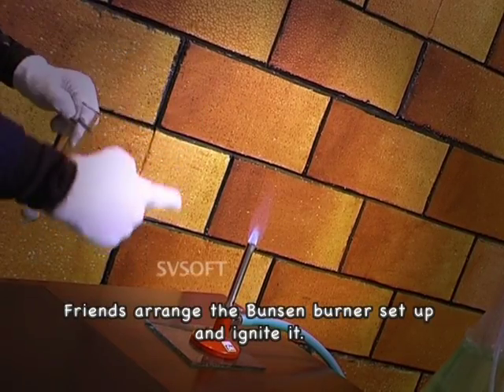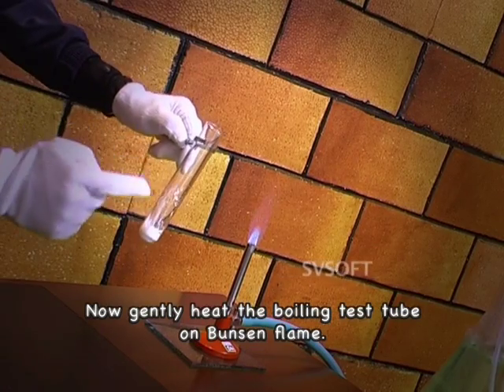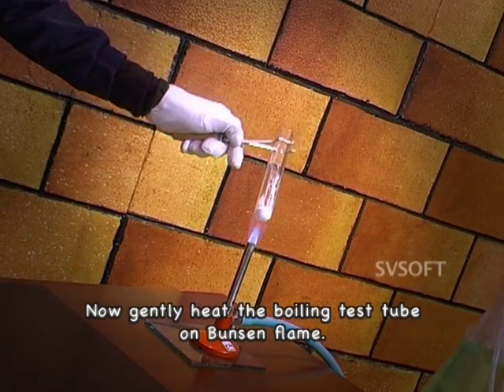Friends, arrange the Bunsen burner setup and ignite it. Now gently heat the boiling test tube on Bunsen flame.